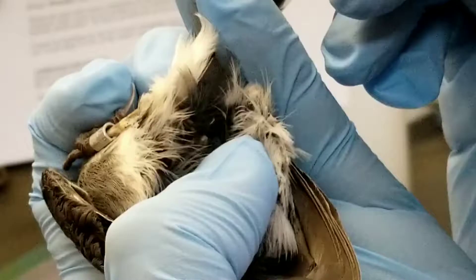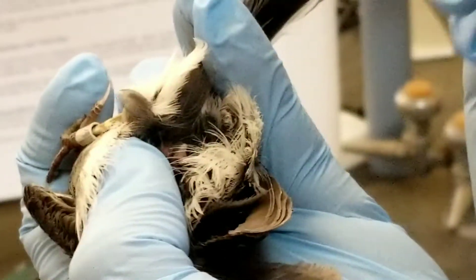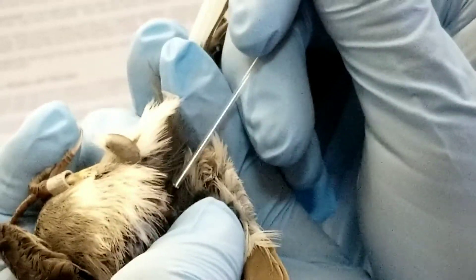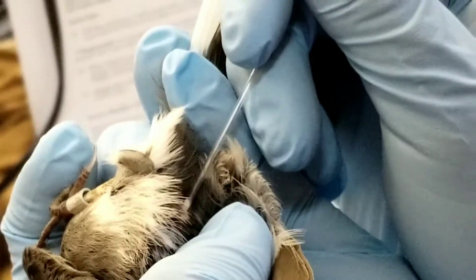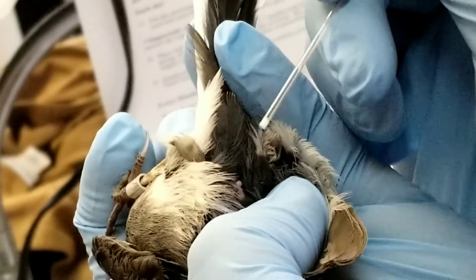One method to getting that out — if I just modify this a bit more — is to take your capillary tube like so, and you just apply a slight little bit of pressure on top. There are different methods of doing this; this is my favored method, and you get a nice sample.